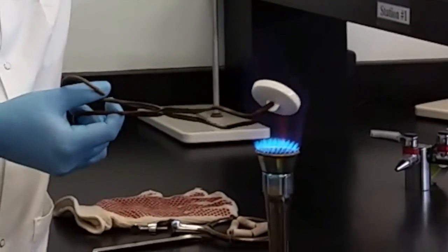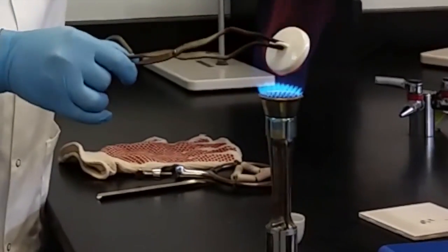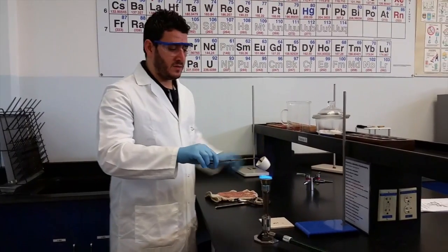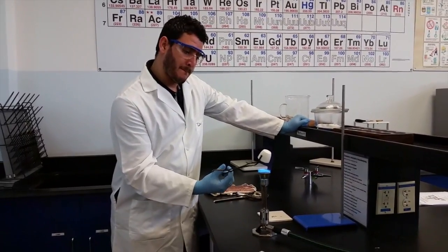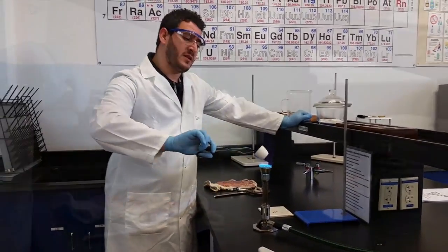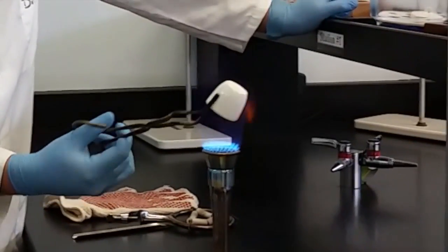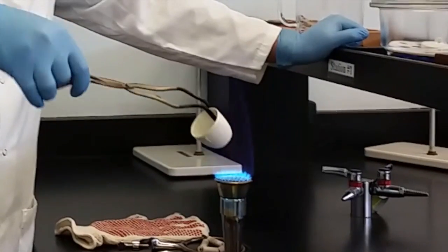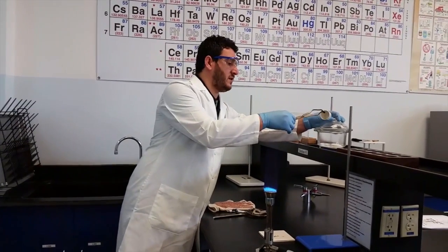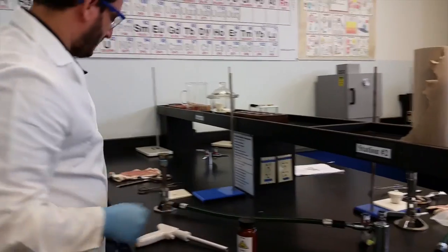You will notice that the color will slightly start to become yellowish. If you look closely at the color of the porcelain, you will see that it starts to lose its white brightness and becomes yellowish, which means it's getting hot and driving out the water inside the holes. This is what you would like to do. Now turn off the burner.